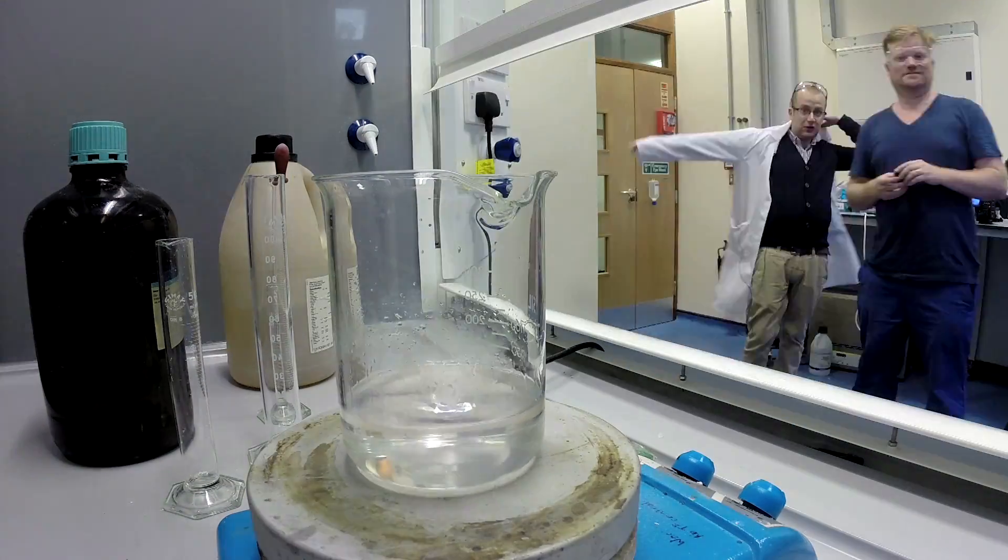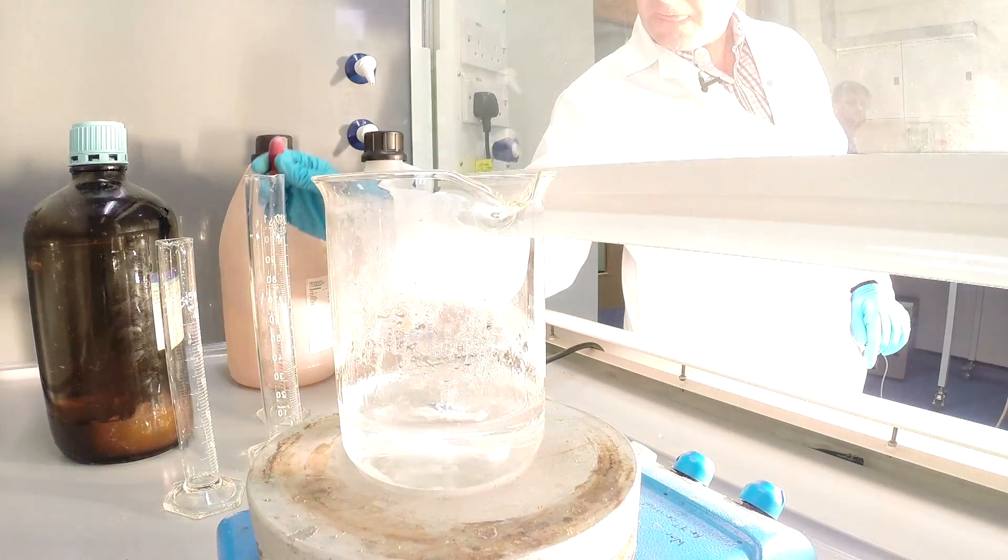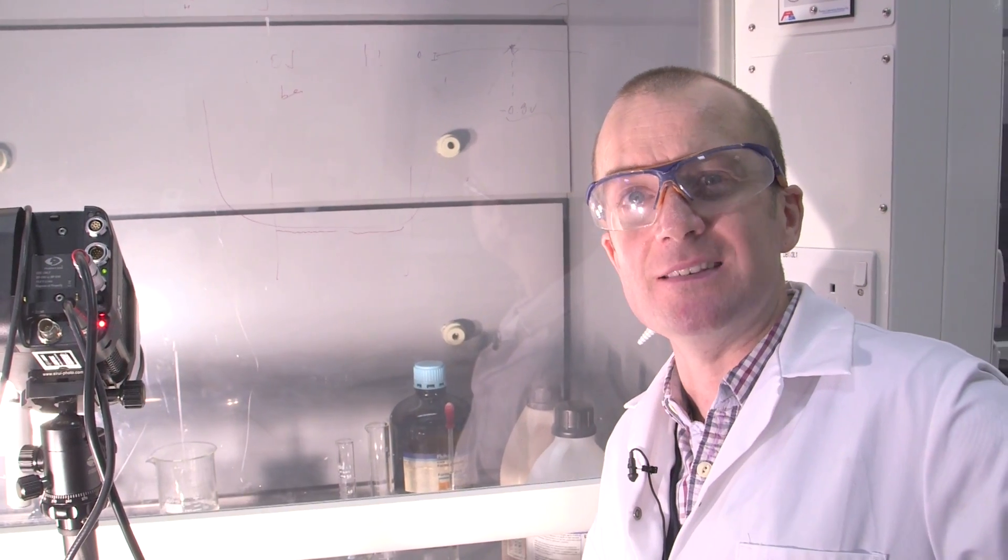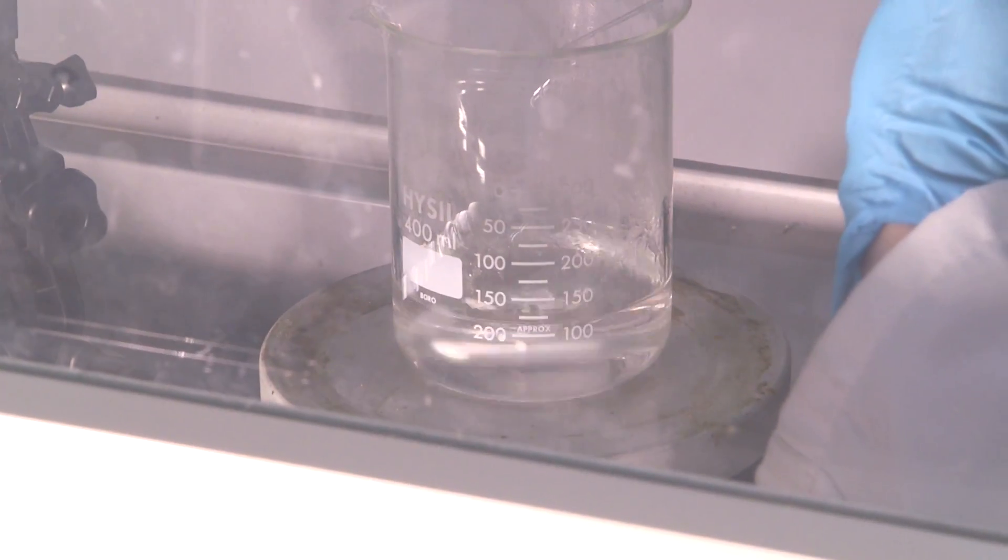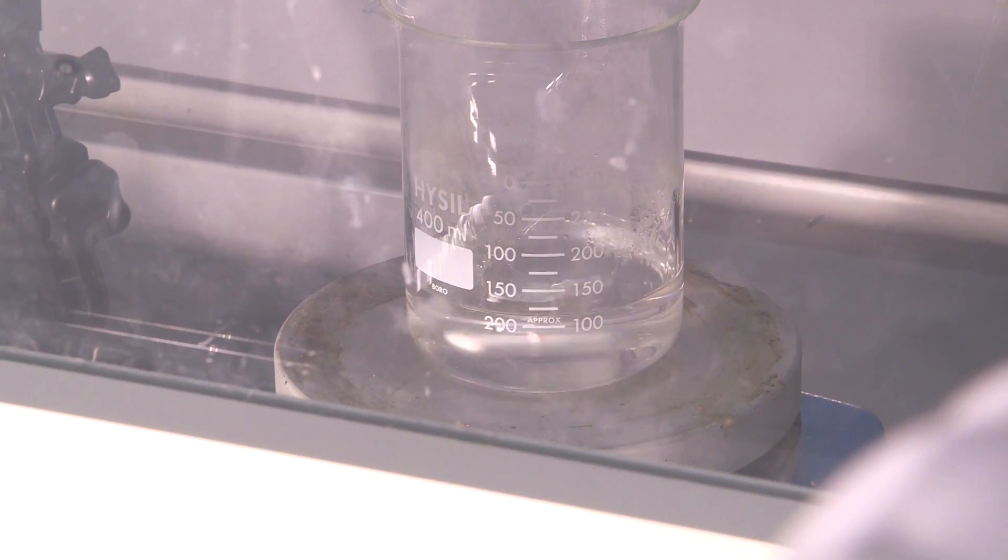Okay, so we're going to give this another go. And the difference this time is we're going to apply a bit more heat and see if there's any difference. Here's our crew again. Ready? What was discovered by Bakeland was that this mixture could be molded and it led to a large number of different objects being made.